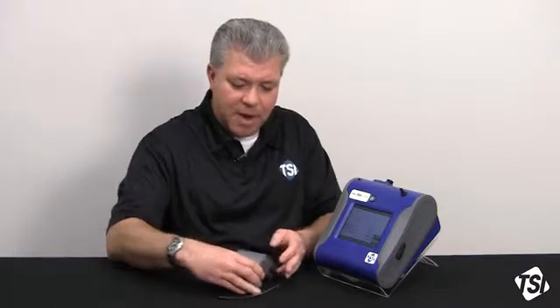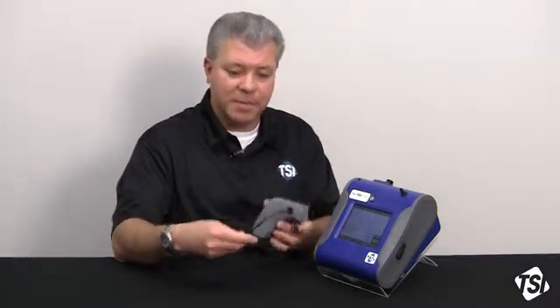So a couple of things to keep in mind. For a 24-hour sample, people will typically set their Auto Zero module frequency at, say, 2 hours, 3 hours, 4 hours, sometimes 6 hours, so that you're getting it fairly regularly during the day. As these temperature conditions vary, and the same thing with humidity, you're actually zeroing out those effects with regularity so that your data will always be optimized for these longer sampling periods. Same thing for indoor air quality. Temperature may change during the day or the evening, humidities may change, so you also want to make sure that you can utilize an Auto Zero module.